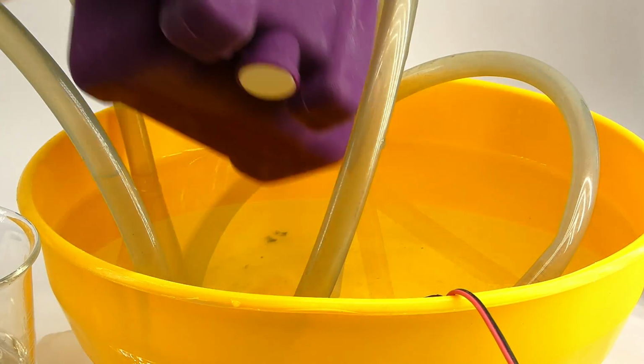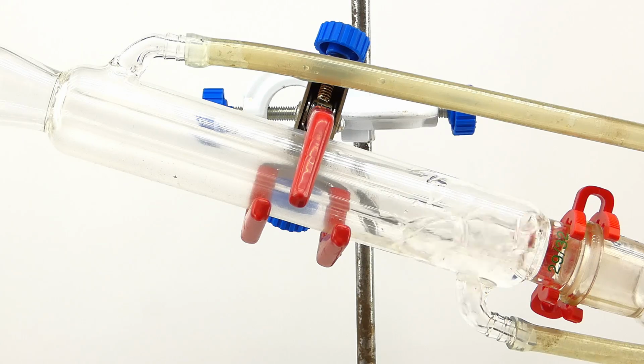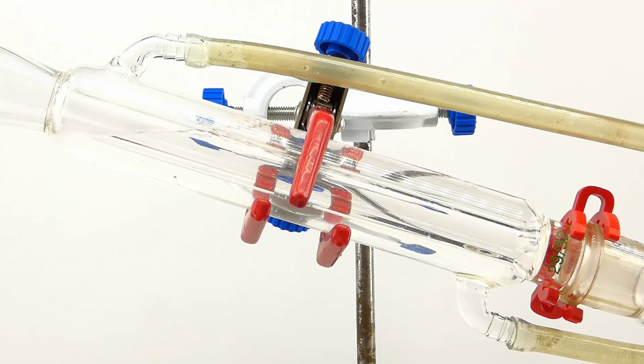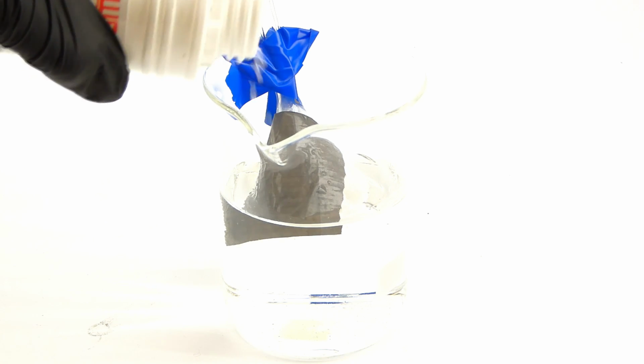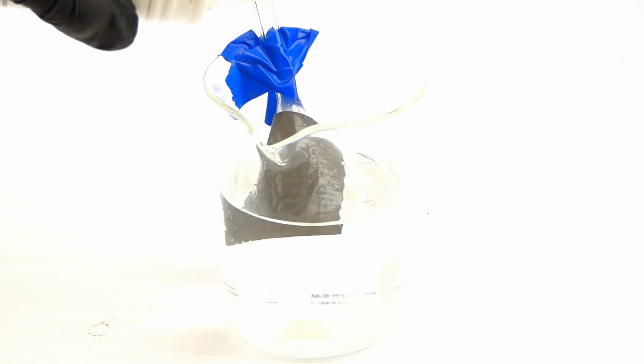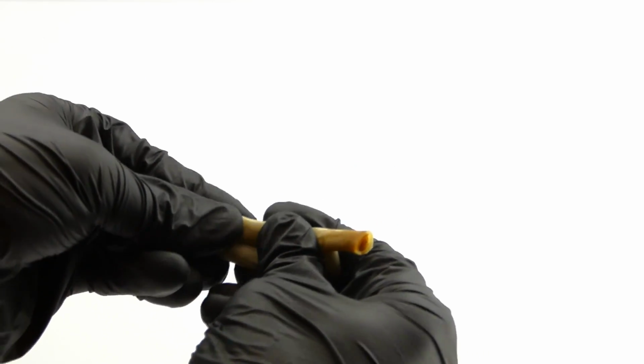Also, even though I used some very cold water to condense the bromine and cool down the receiving flask, some of its vapors are still going to escape, and that's why I built this inverse funnel trap filled with a sodium thiosulfate solution, which will neutralize most of them, prevent suckback, and most importantly, help preserve my fume hood because bromine vapors can completely obliterate plastic tubing.